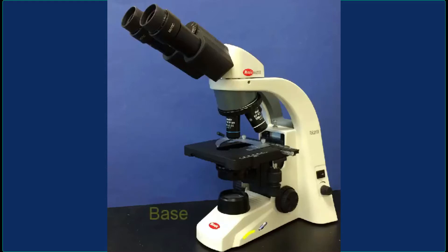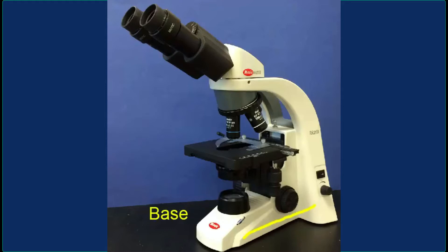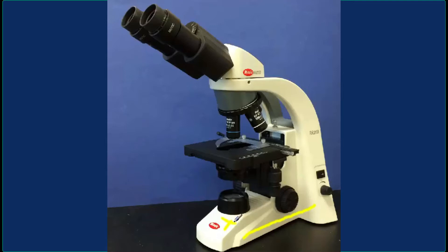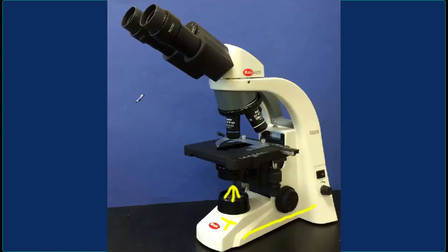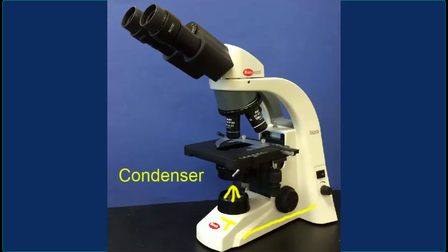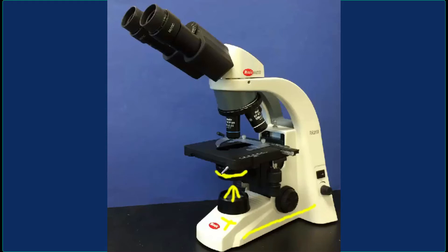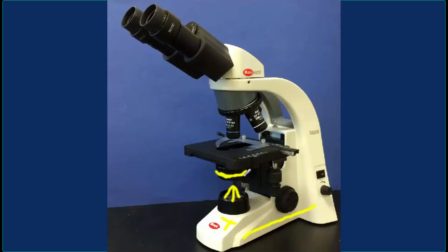First of all, right over here you have the base, and in the base you're going to find the light source. There's a bulb right over here that provides the light, and the light goes through this lens here. The light is then going to enter a condenser lens. The condenser lens is underneath the mechanical stage — here is the housing that holds the lens in position.